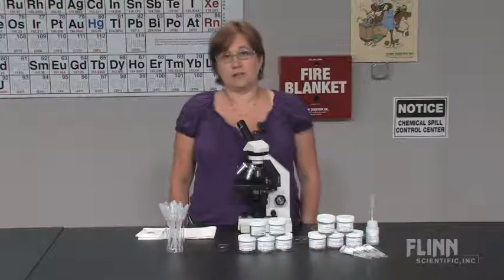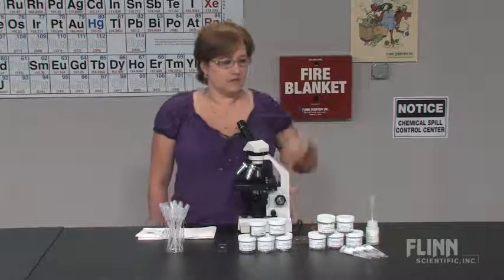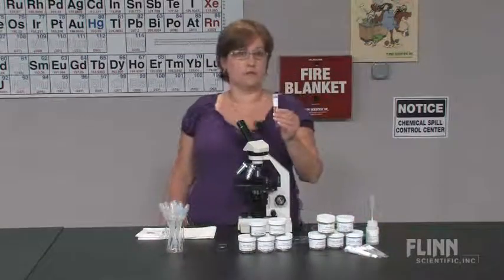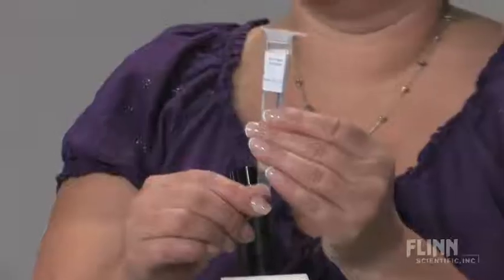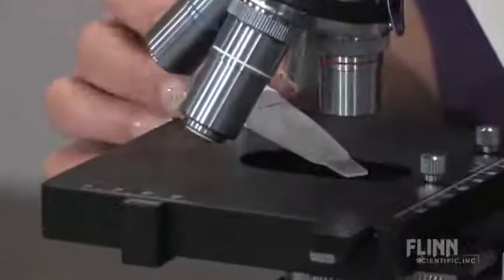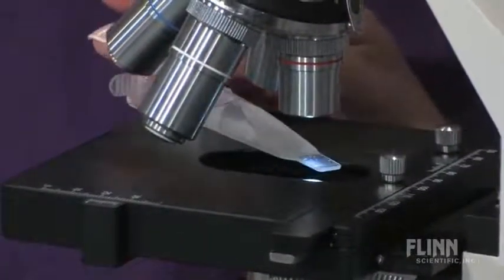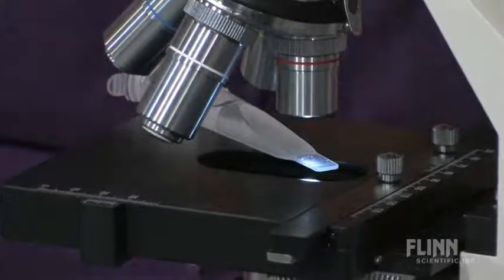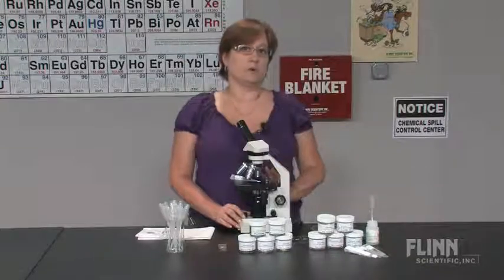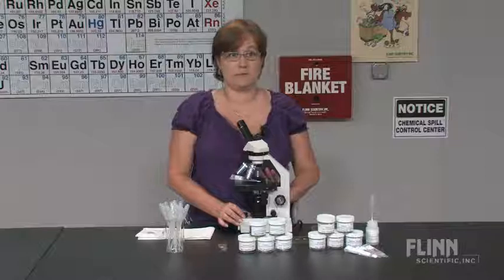You can easily find the microorganisms if you know where to look. For novices, I recommend something called a demo slide. These are culture tubes with a very thin end. Simply put the thin end on the microscope, focus, and locate your microorganisms. These are great for when you're doing a demonstration to show the students what they're looking for before they get started.